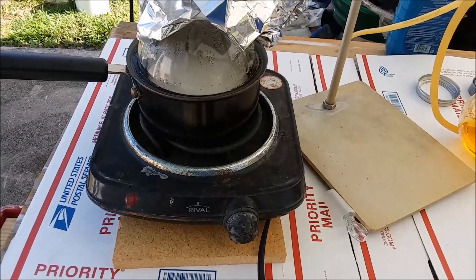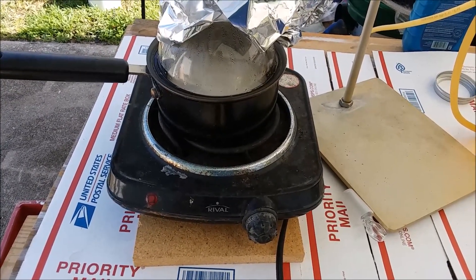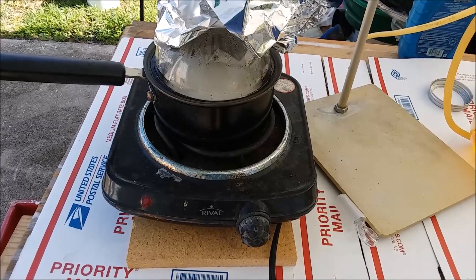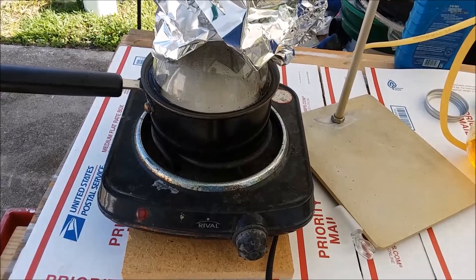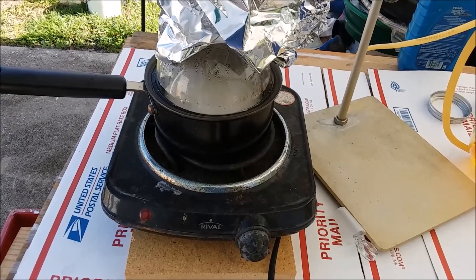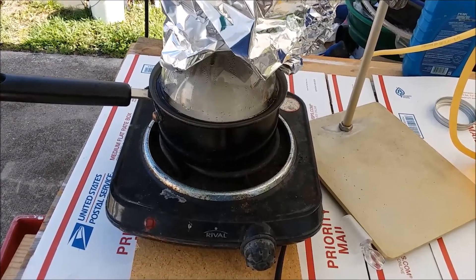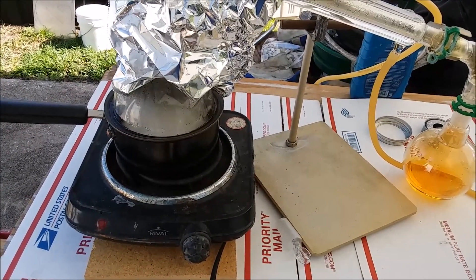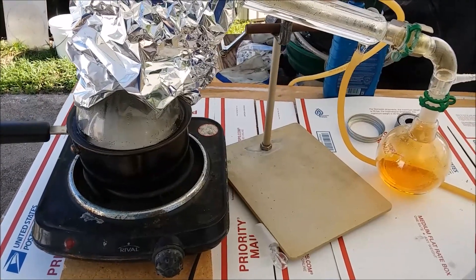The foam-over — yeah, maybe it's not my crappy hot plate that's the problem, because the exact same thing happened as last time. The reaction was going along nicely, vigorous but not out of control, and then all of a sudden in the blink of an eye it got up to where it wanted to foam over. I had to turn the heat off and hope it didn't foam into the condenser — fortunately it didn't. This seems to be a property of this reaction: it'll go along sedately for a while and then get kicked into high gear.